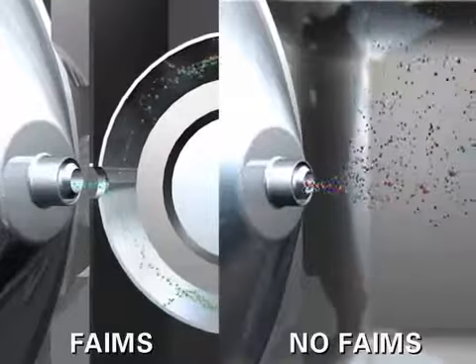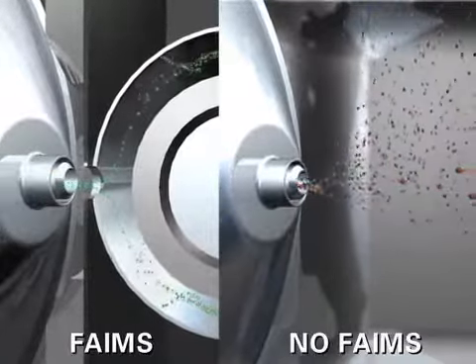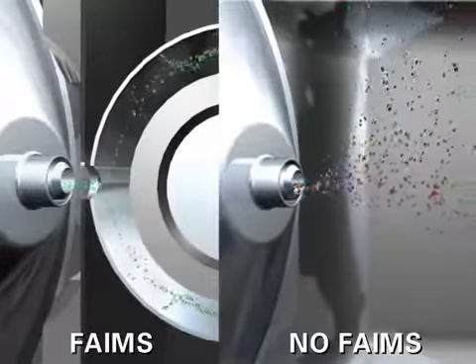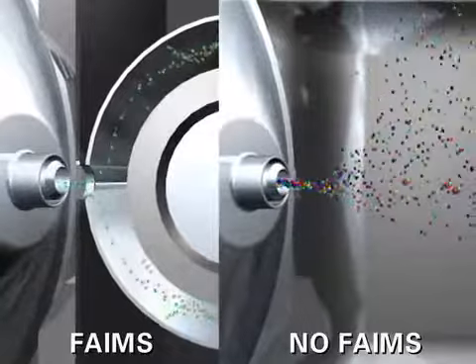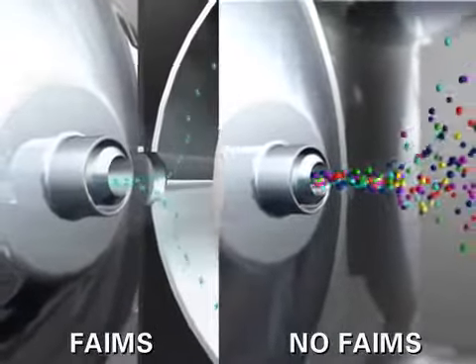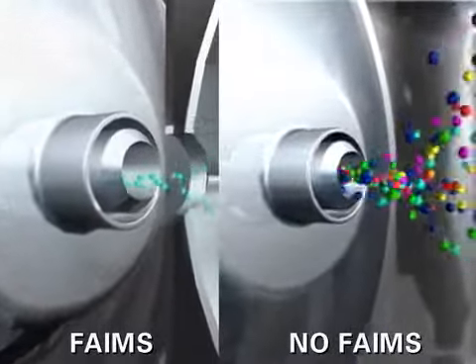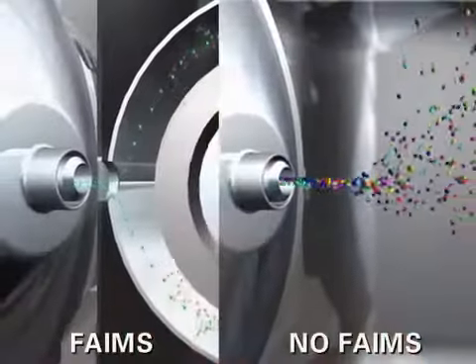Over many cycles of the waveform, ions travel towards one or the other electrode. A low DC voltage compensates for this migration by drawing the ion of interest back to the center of the device. This results in a select ion subset being transmitted into the mass spectrometer. Since only the ion of interest is passed into the mass spectrometer, it leaves the mass spectrometer's components cleaner. The goal is to get the greatest selectivity possible, and that's what FAIMS offers.